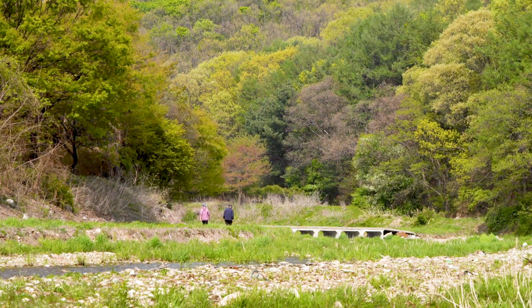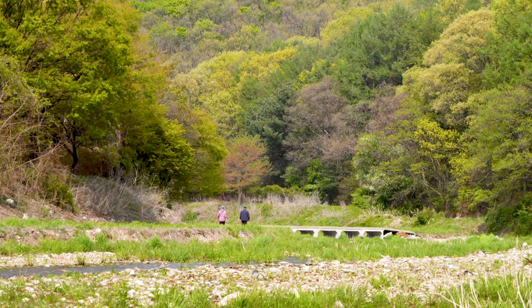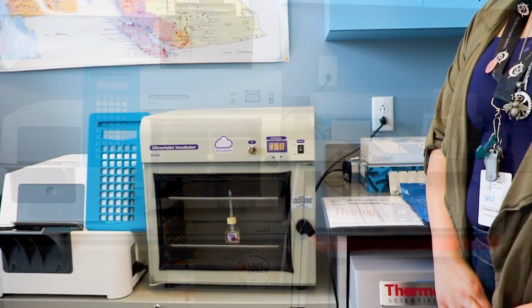One of our most important tasks is conducting microbiological analysis. You must follow good sampling practices because it is very easy to contaminate a microbiological sample with bacteria from dirty hands and surfaces. You need an appropriate laboratory environment to carry out correct sampling and testing procedures. Environmental health officers will work with you and Chief and Council to ensure that there is a suitable laboratory environment to conduct drinking water sampling and testing.